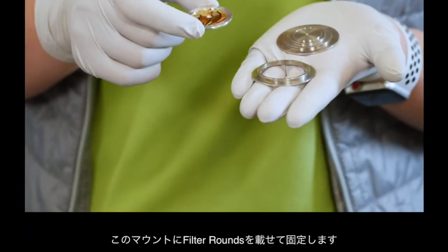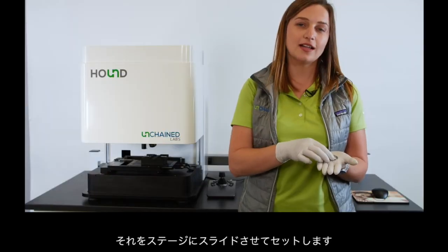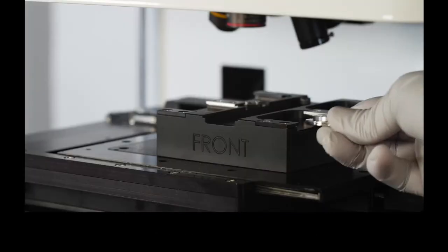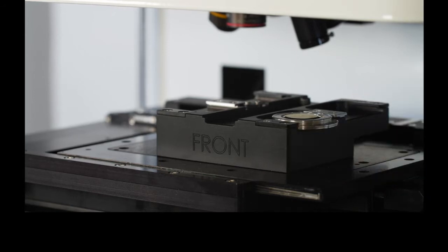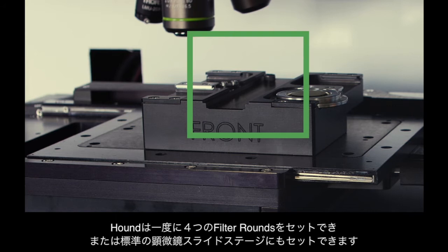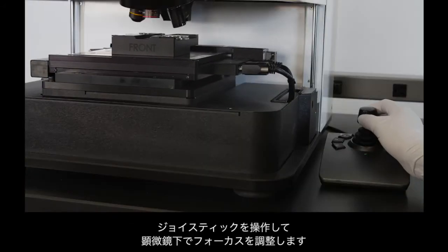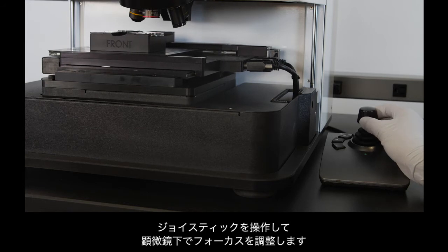I place the filter round into the sample mount. Then I slide it into the stage. Hound can hold up to 4 filter rounds or a standard microscope slide. I'll use the joystick to move it under the microscope, navigate, and adjust focus.